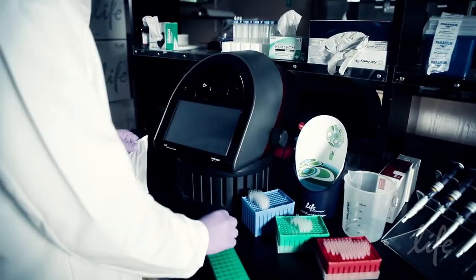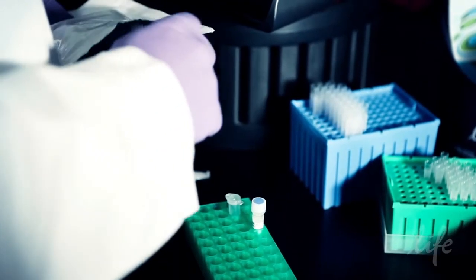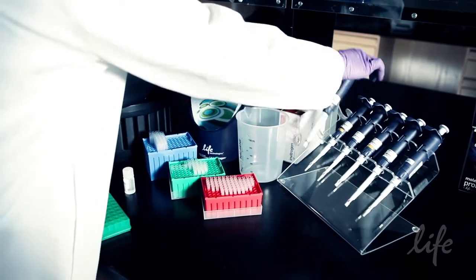Adam has a freshly prepared aliquot of his sample. He is resuspending the cells in Annexin binding buffer so there is at least 100 microliters of cell suspension per individual assay.